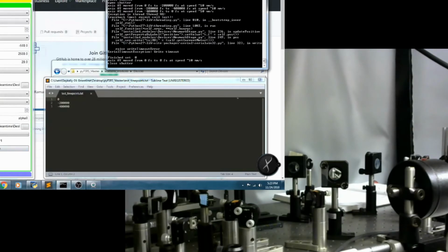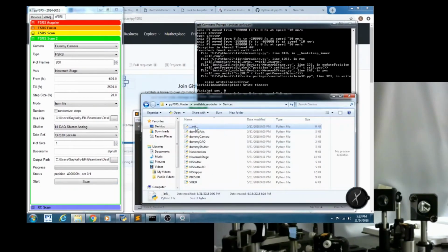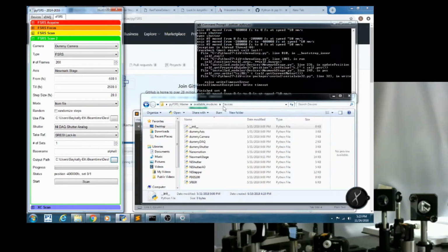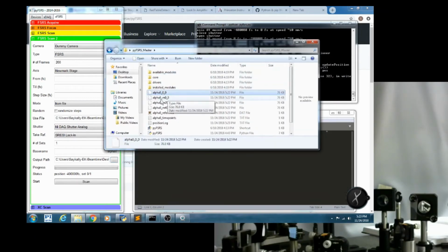The final thing I want to show you is the output files, which are loaded. So here we have to navigate to where we save the output to. So here I saved it to pyFSRS master. So we navigate to that folder, and we see alpha 0 is at 0 time point, then M200,000 is minus 200,000 time, M400,000 is negative 400,000, alpha is the base name, and then 0 tells you which set it was. So if you were to sweep out multiple sweeps of the translation stage, you would go up from 0 to 1 to 2.